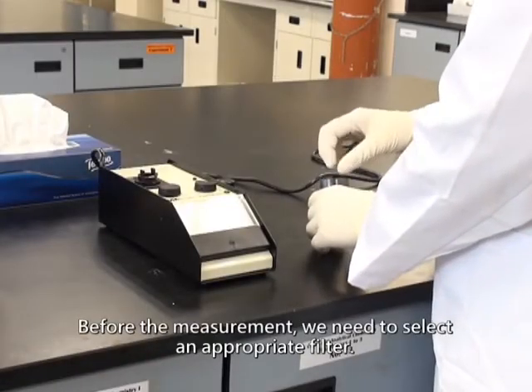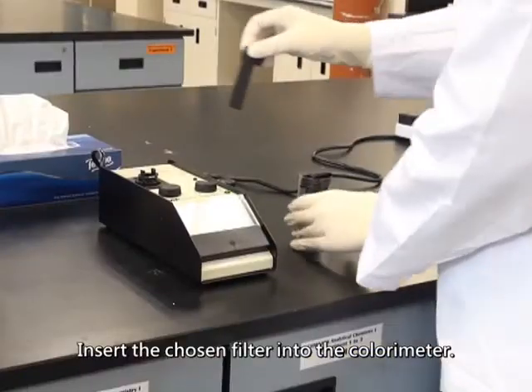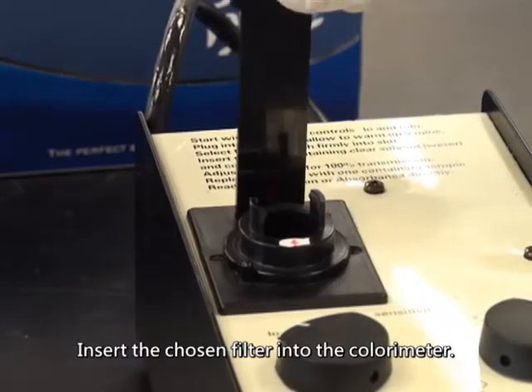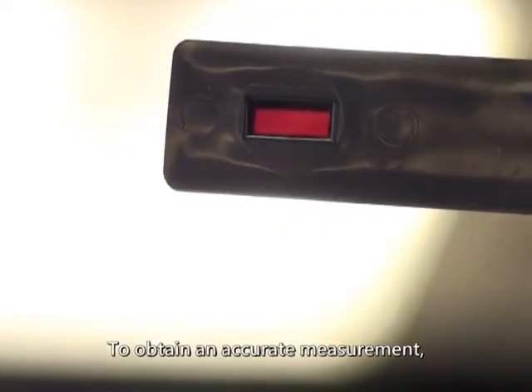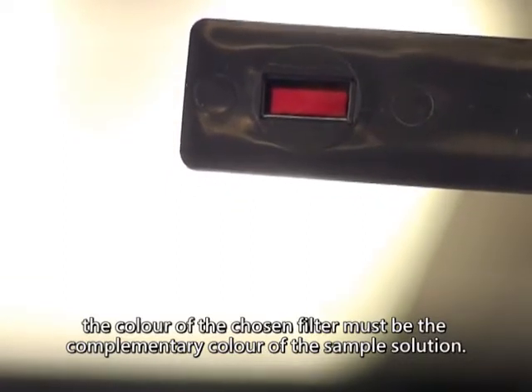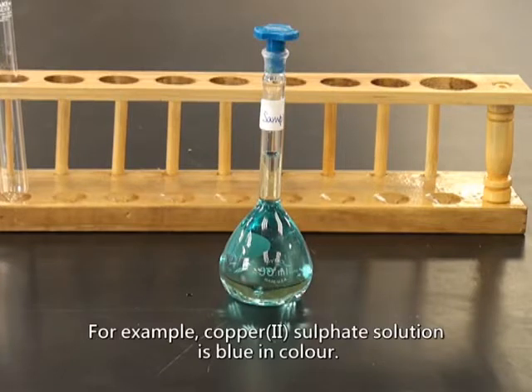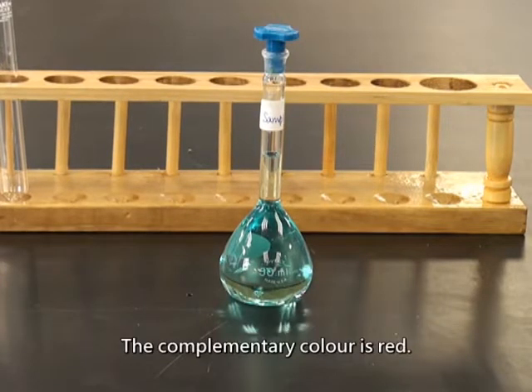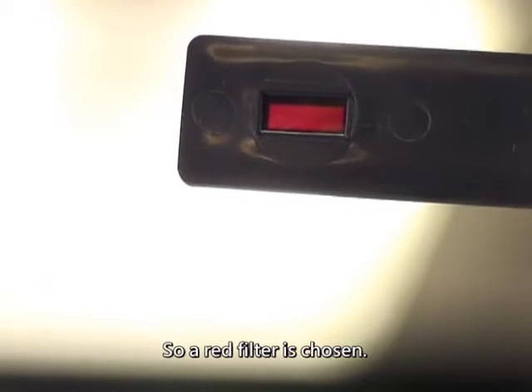Before the measurement, we need to select an appropriate filter. Insert the chosen filter into the colorimeter. To obtain an accurate measurement, the color of the chosen filter must be the complementary color of the sample solution. For example, copper(II) sulfate solution is blue in color. The complementary color is red. So a red filter is chosen.